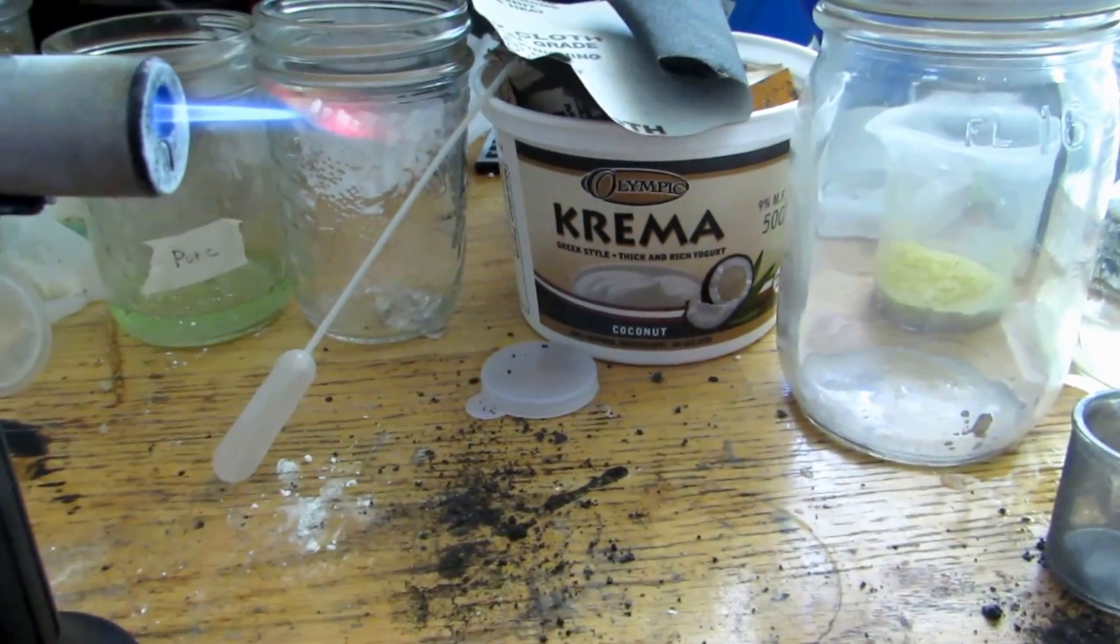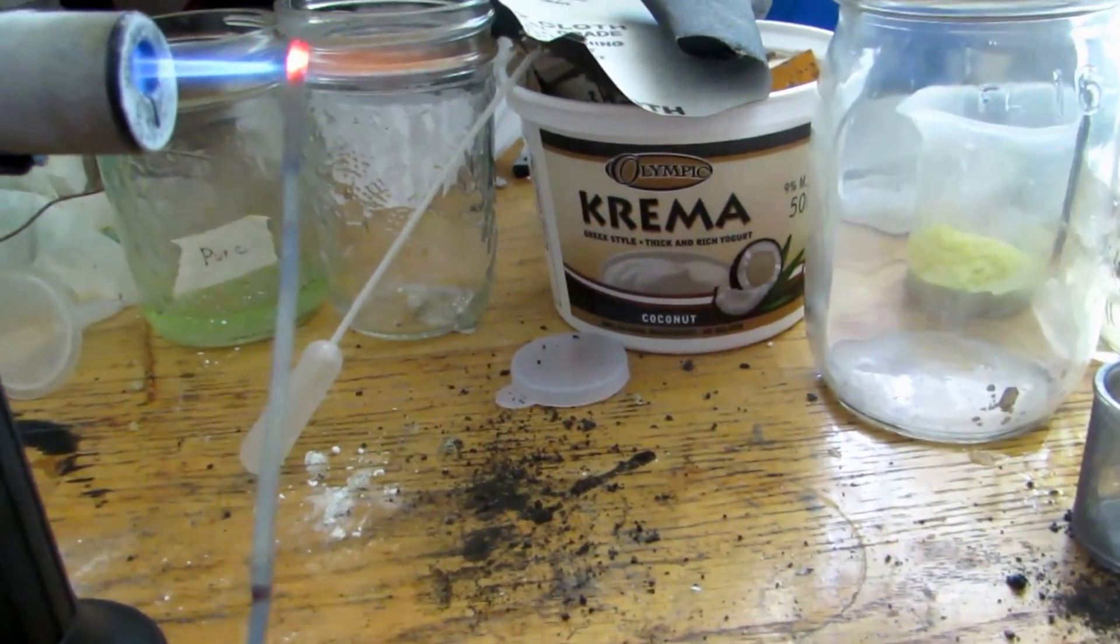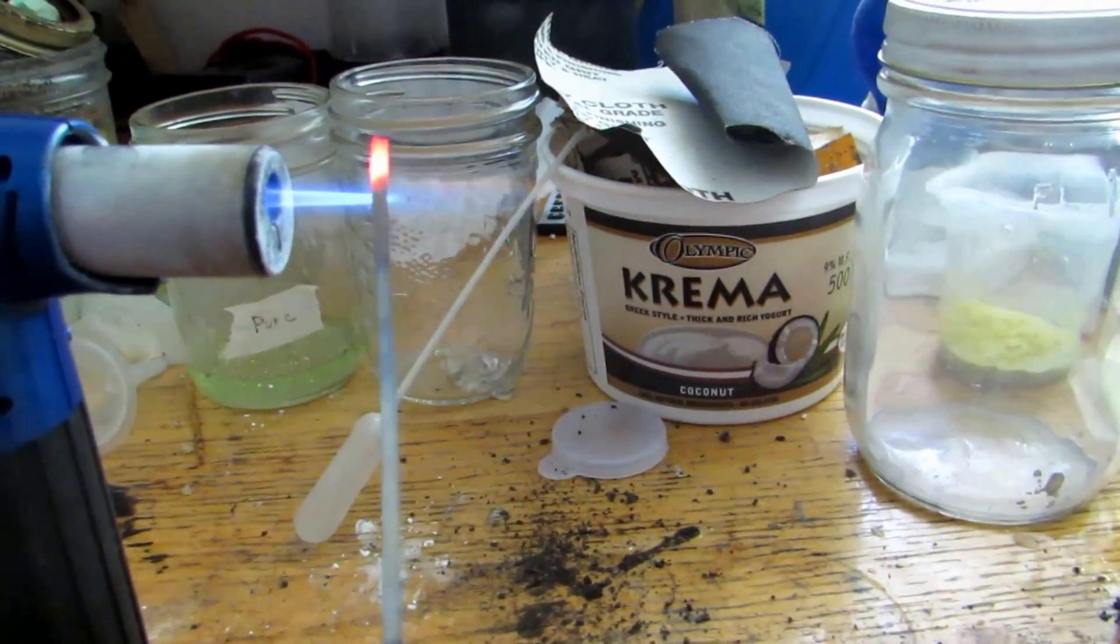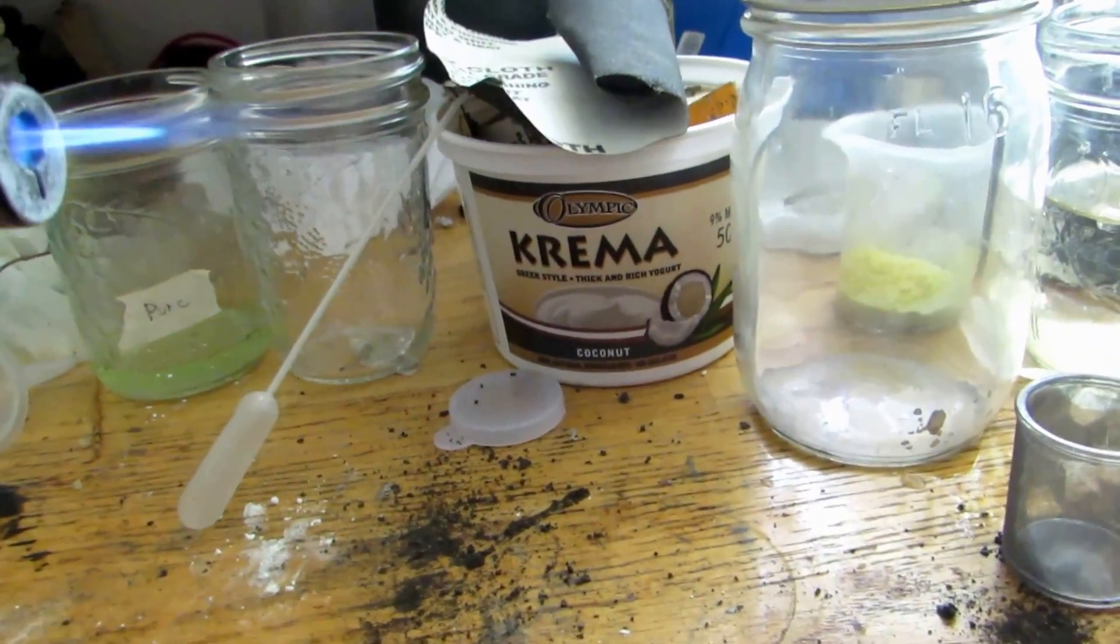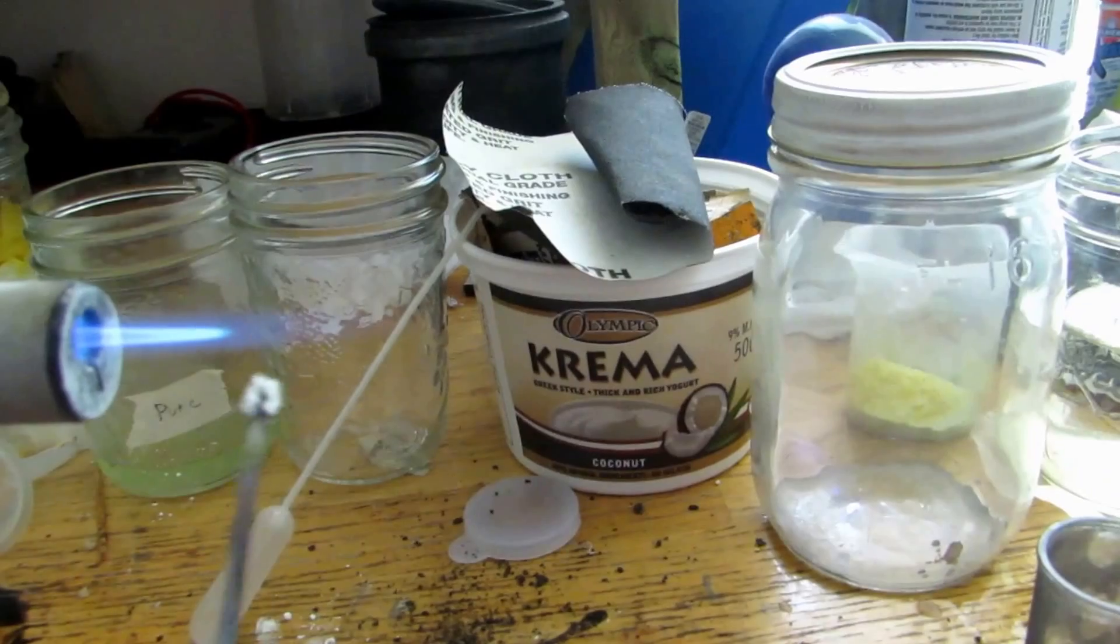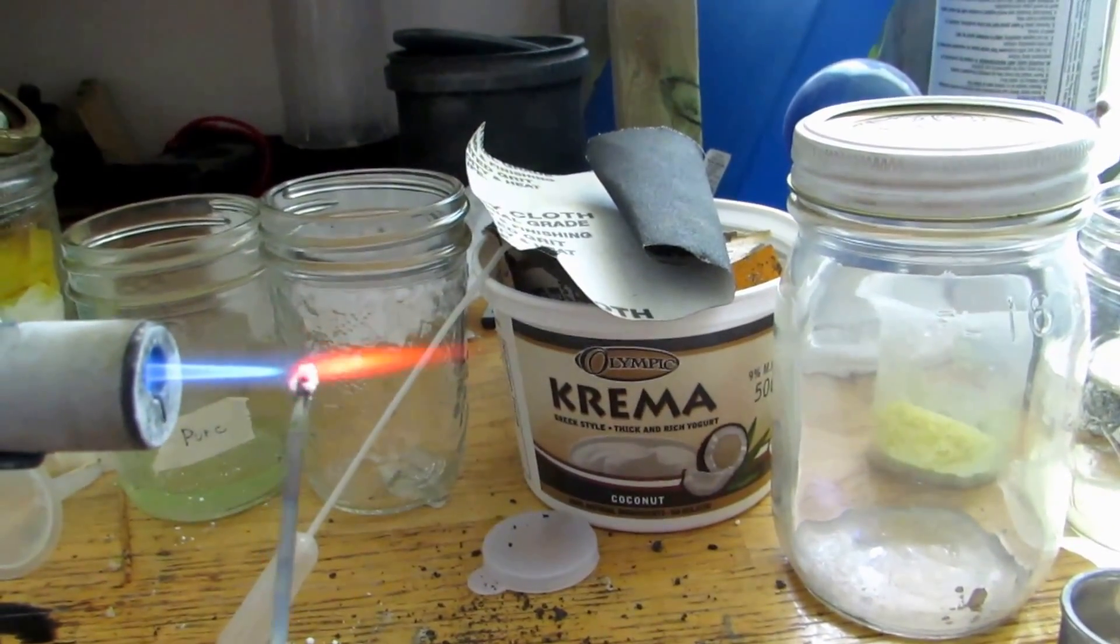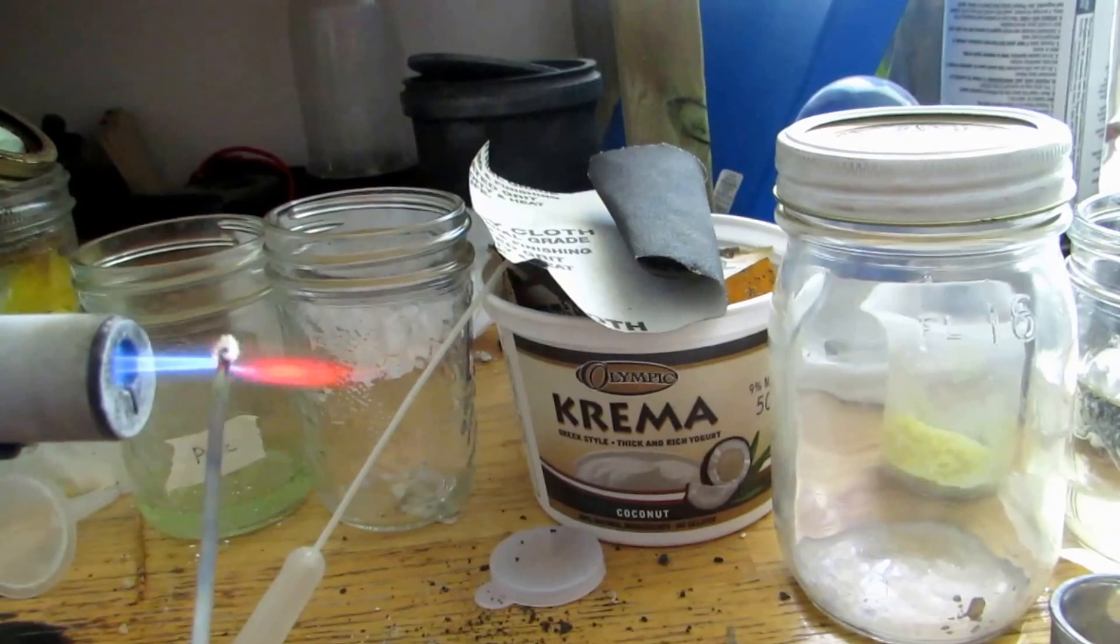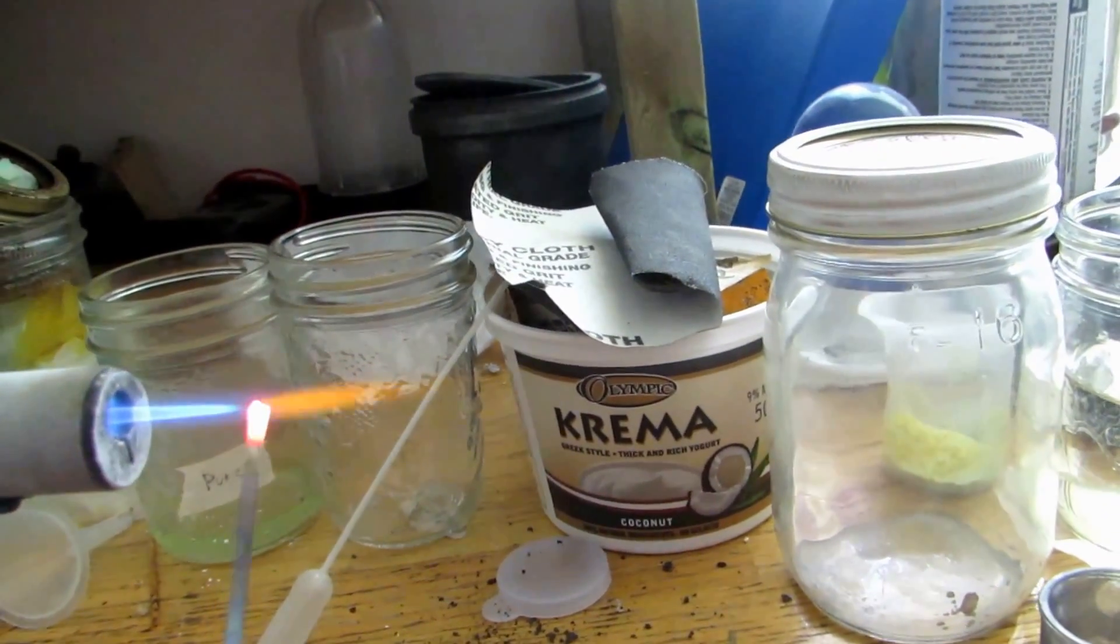And in a flame, you can see it has a beautiful reddish color to it. Well, that's kind of sodium. Might be some sodium contamination. Let's get a bit more on there and try this again. You can clearly see the red color, and there appears to be some sodium contamination just from the bright orange that comes off after all the strontium is gone.